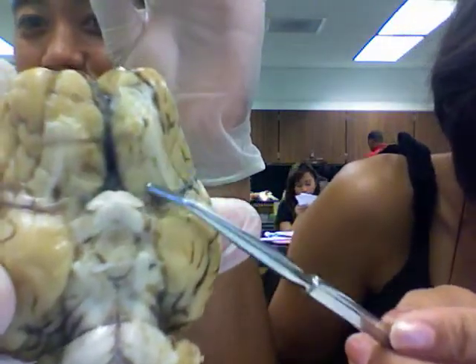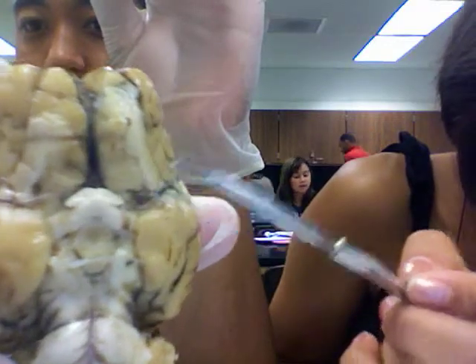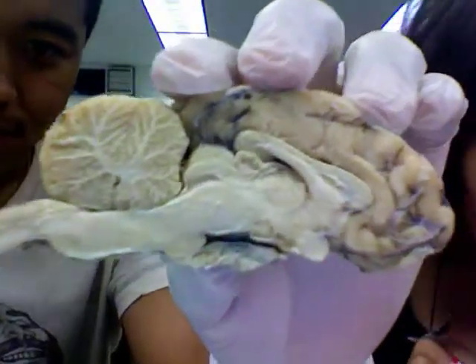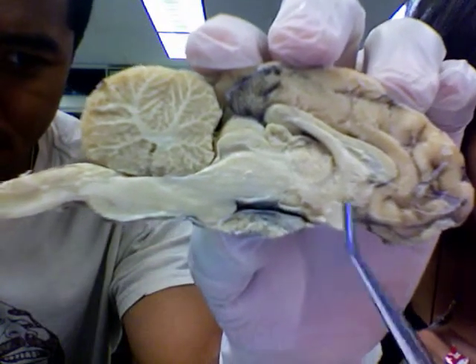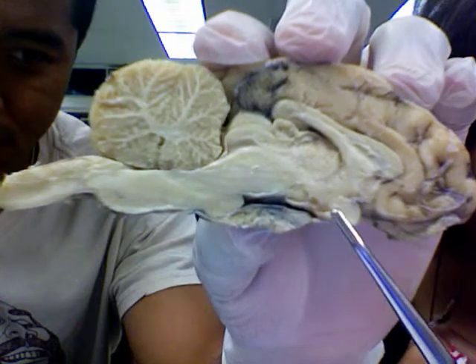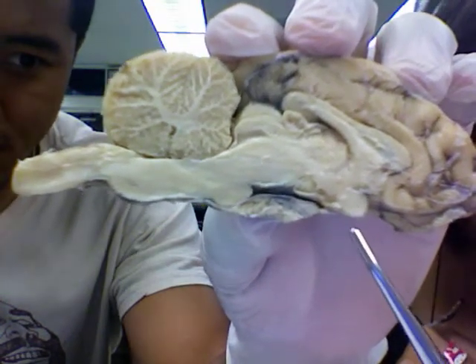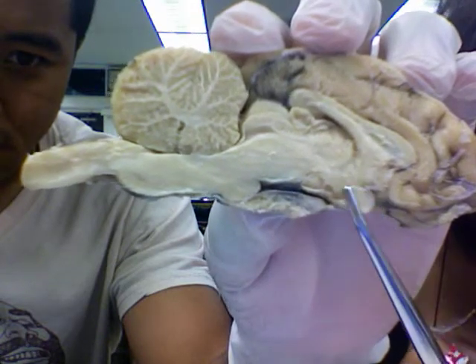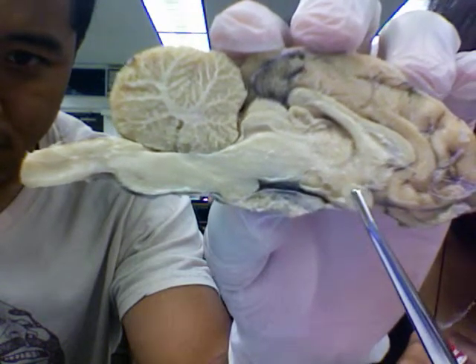Okay, these are the olfactory bulbs. And then the optic chiasm is probably this right here — right? Yeah. Optic chiasm, and thalamus.